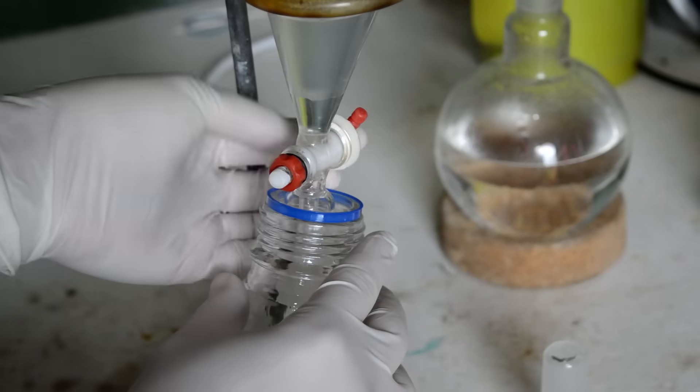We probably should run another distillation. But look, it should be fine. It's not, but we'll get to that later.